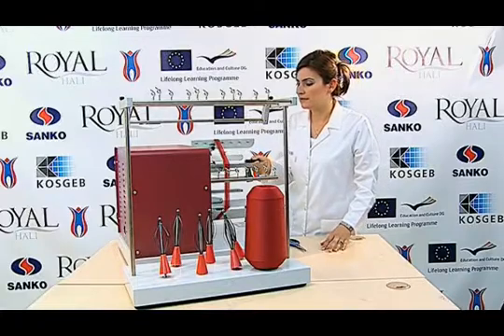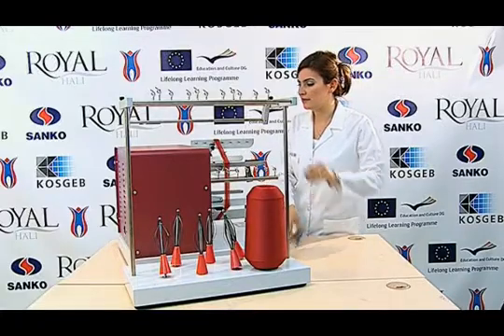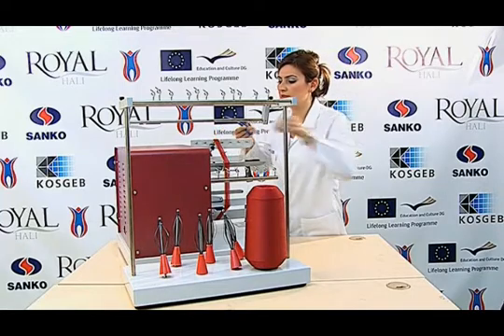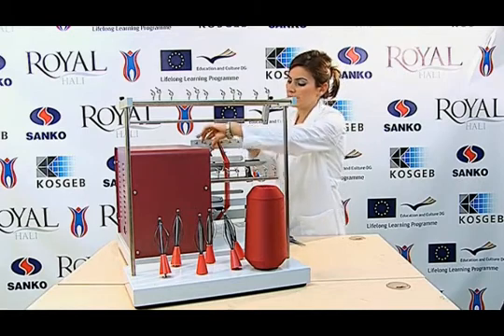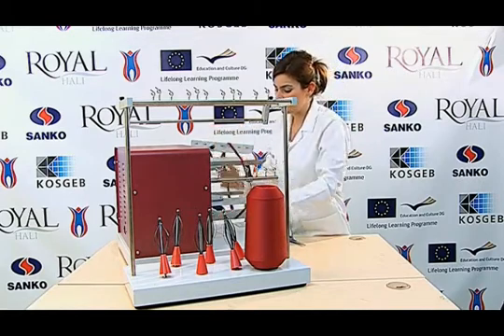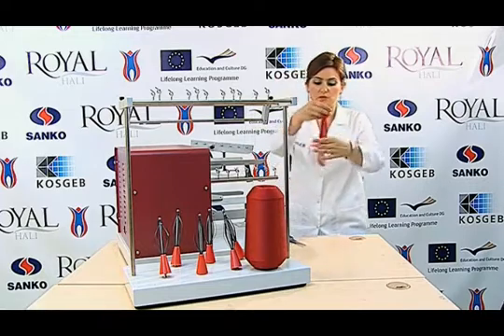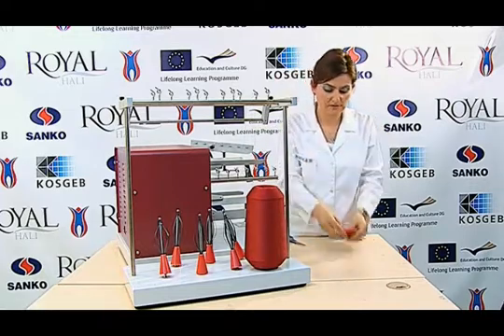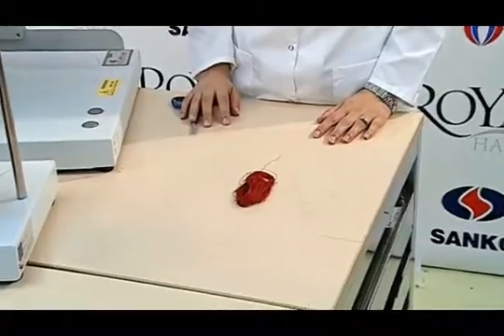After completing 100 meters, the reels are taken to the starting point and then we cut the yarn from the end. By lowering the first handle, we take our sample out. Five samples are prepared in this manner and then weighed in the precise balance.